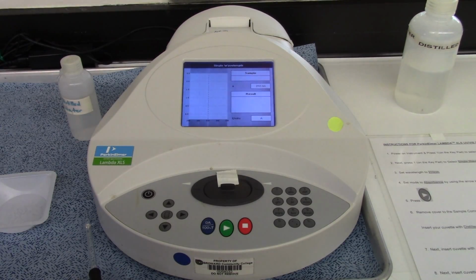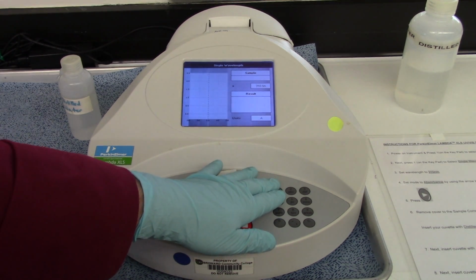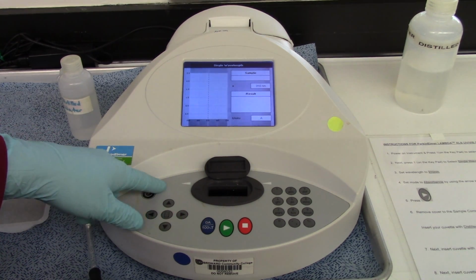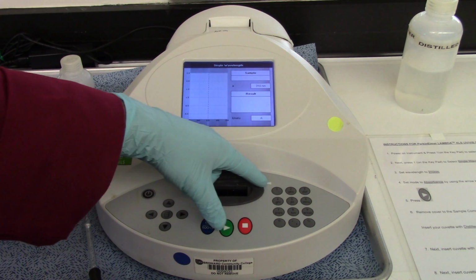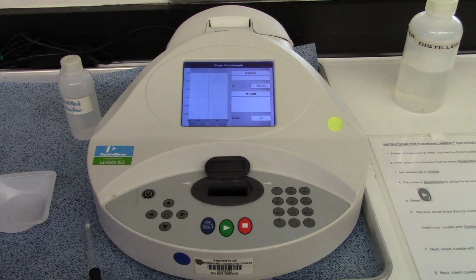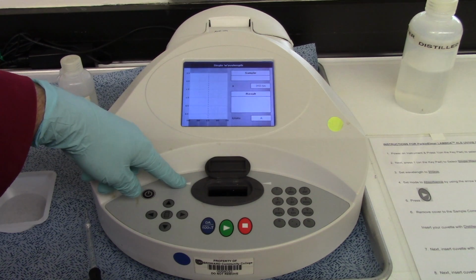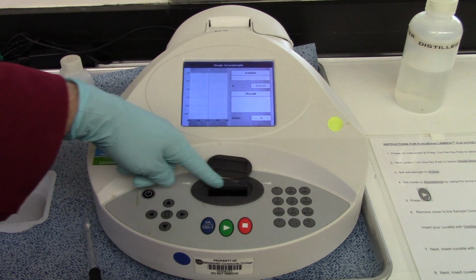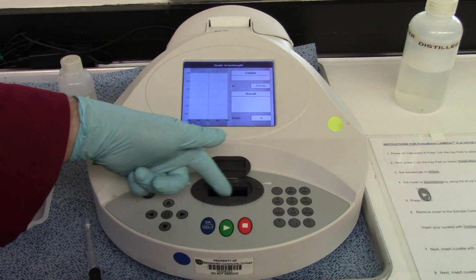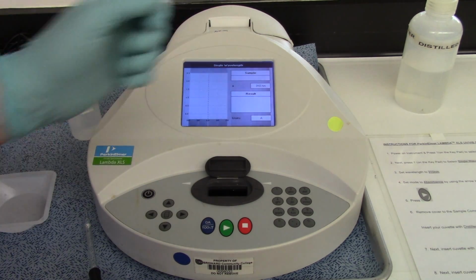Okay, class, here we are looking at a spectrophotometer. What we have over here is a light source that's going to shine light through this chamber right here. And there's a light detector on this side of the instrument. As the light passes through our sample, the vitamin C that's dissolved in the water will absorb some of that light, so less light will get through to here than the machine sent out. So the machine sends out a known amount of light from here to here and can detect that. If anything's in the way that blocks the light from going from here to here, the machine will pick that up and it'll give us a readout up here.